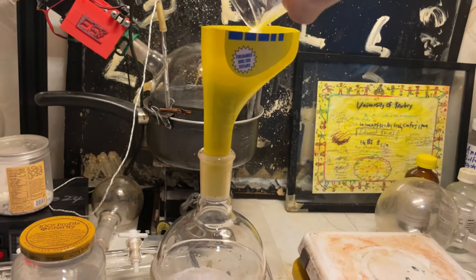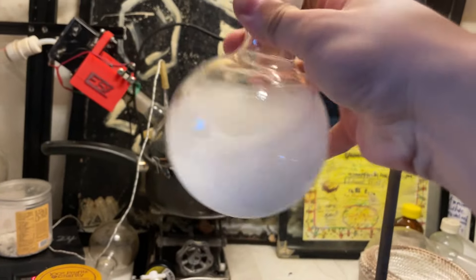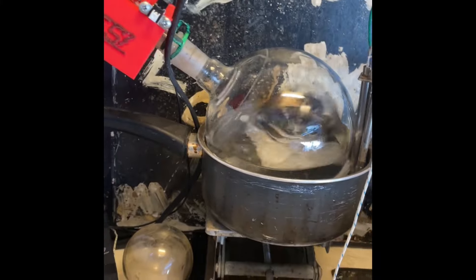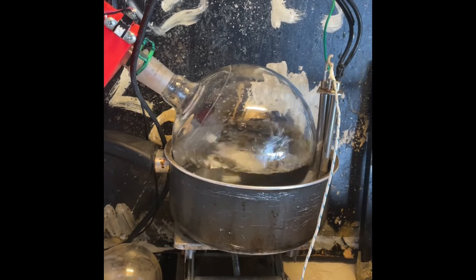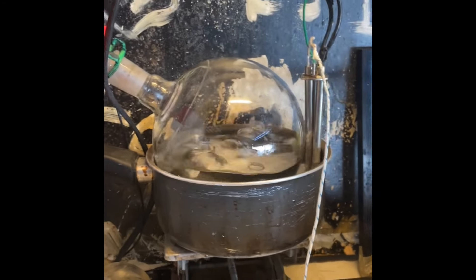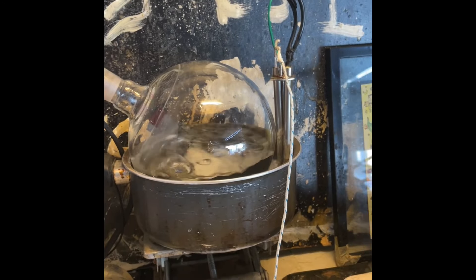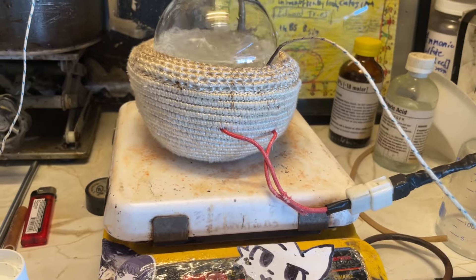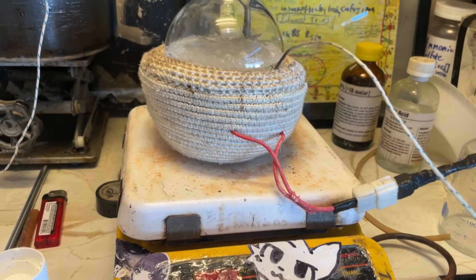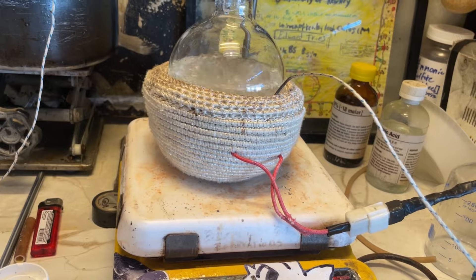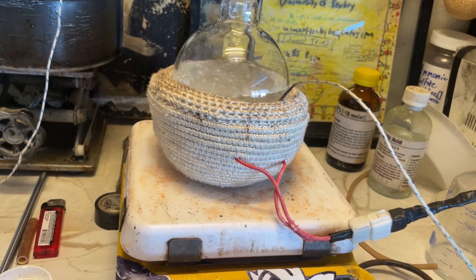So I'm just gonna throw everything into a 500ml flask and add around 200ml of water to dissolve it all. Theoretically, I should actually use a liter of water. But I don't want to do that. Anyways, so here's that reflux, and I'm gonna reflux it for seven hours.